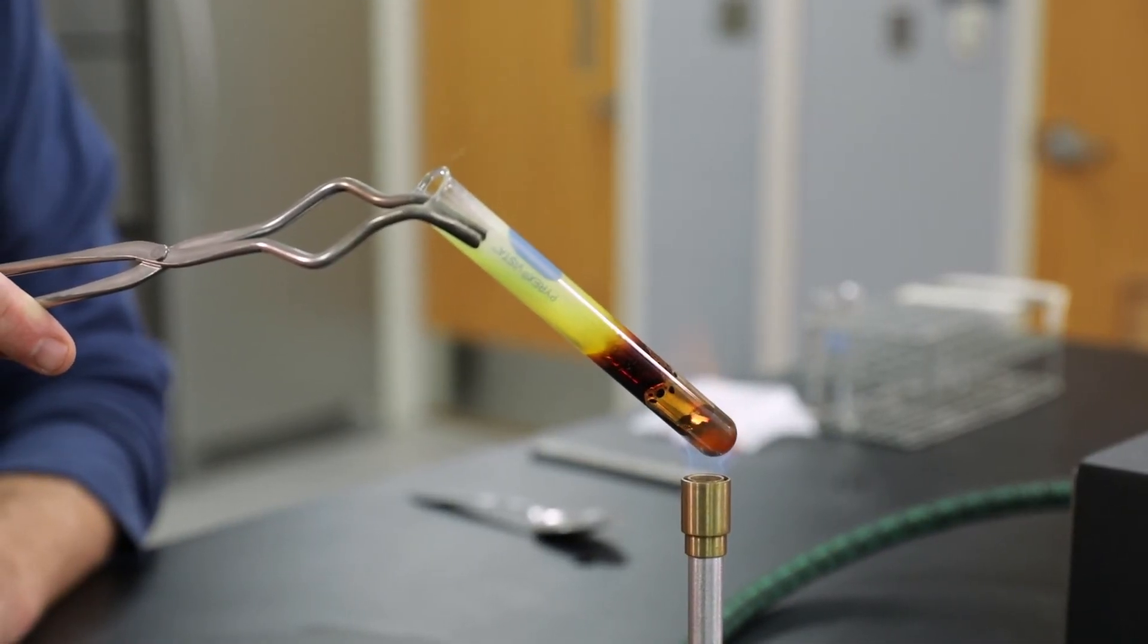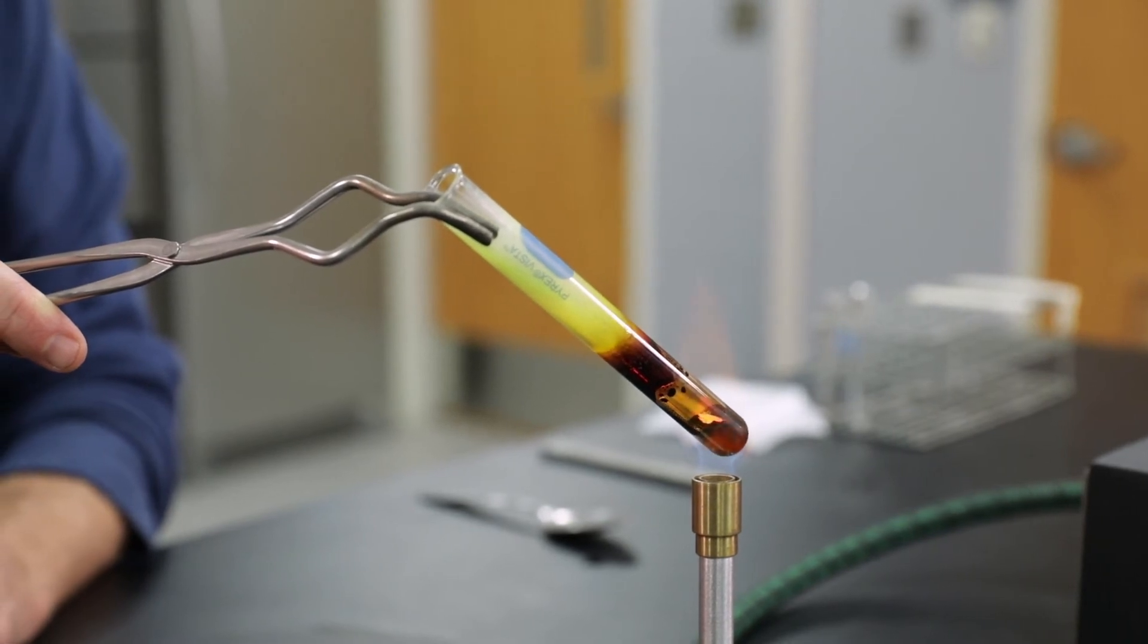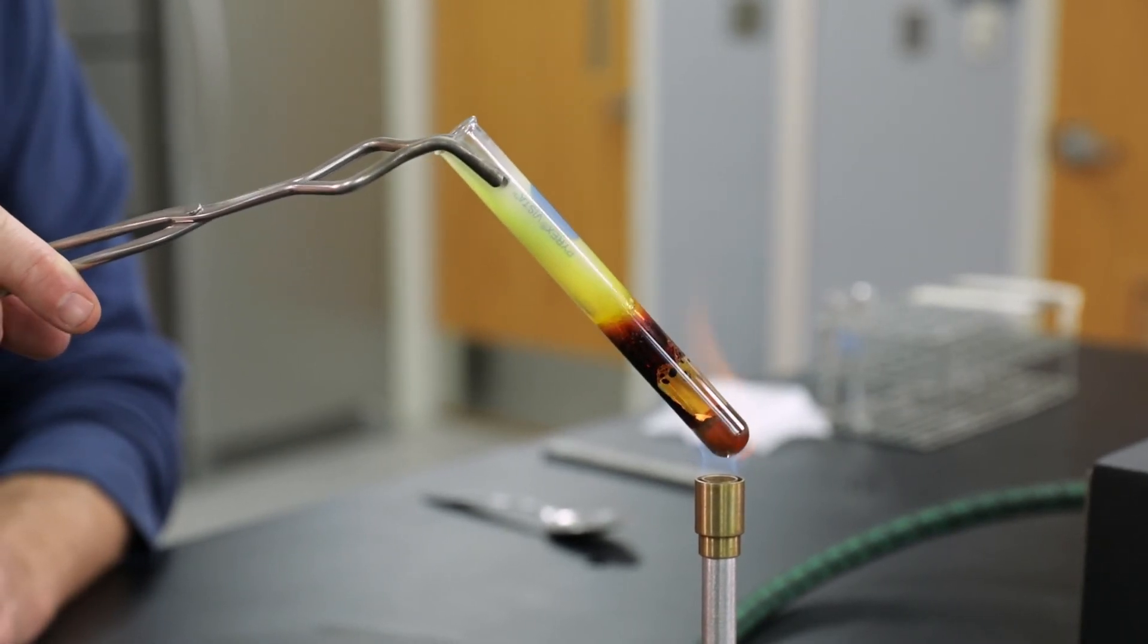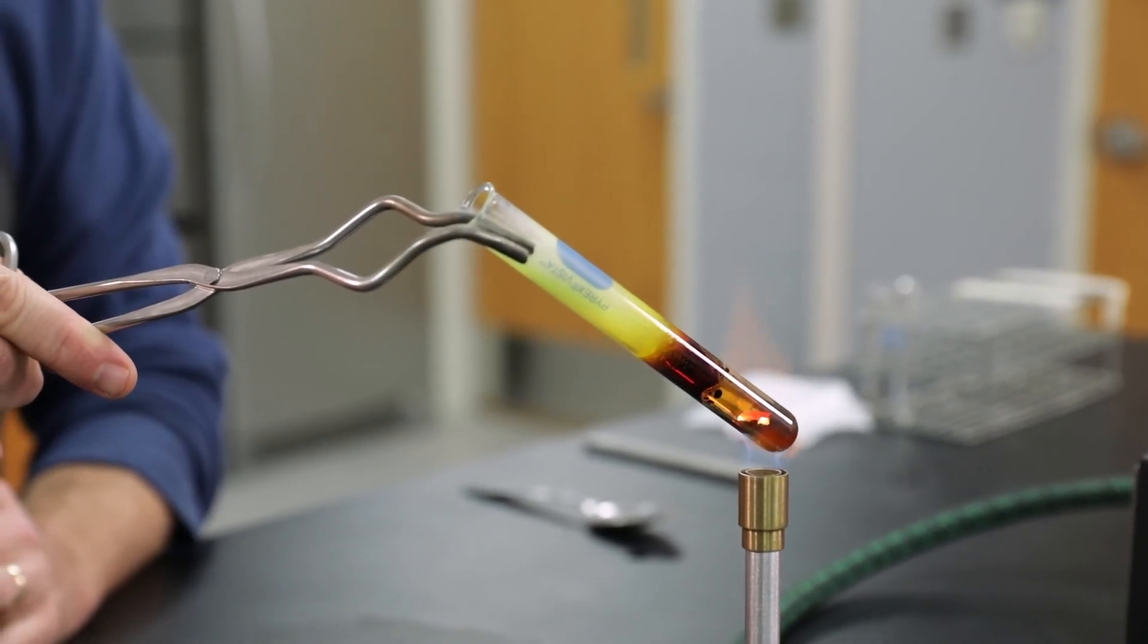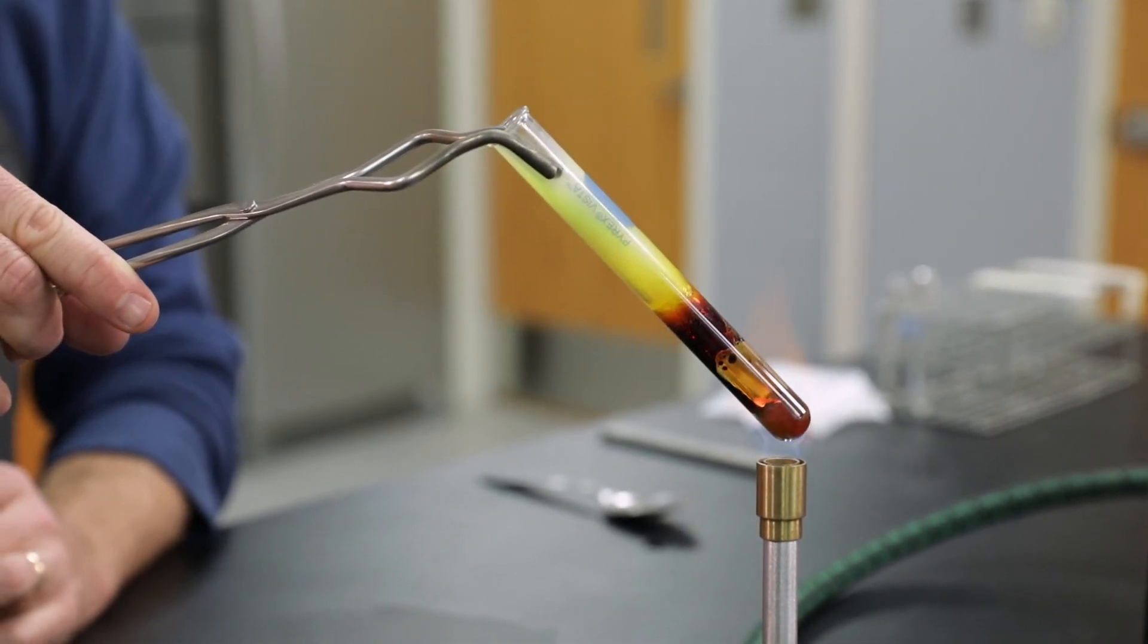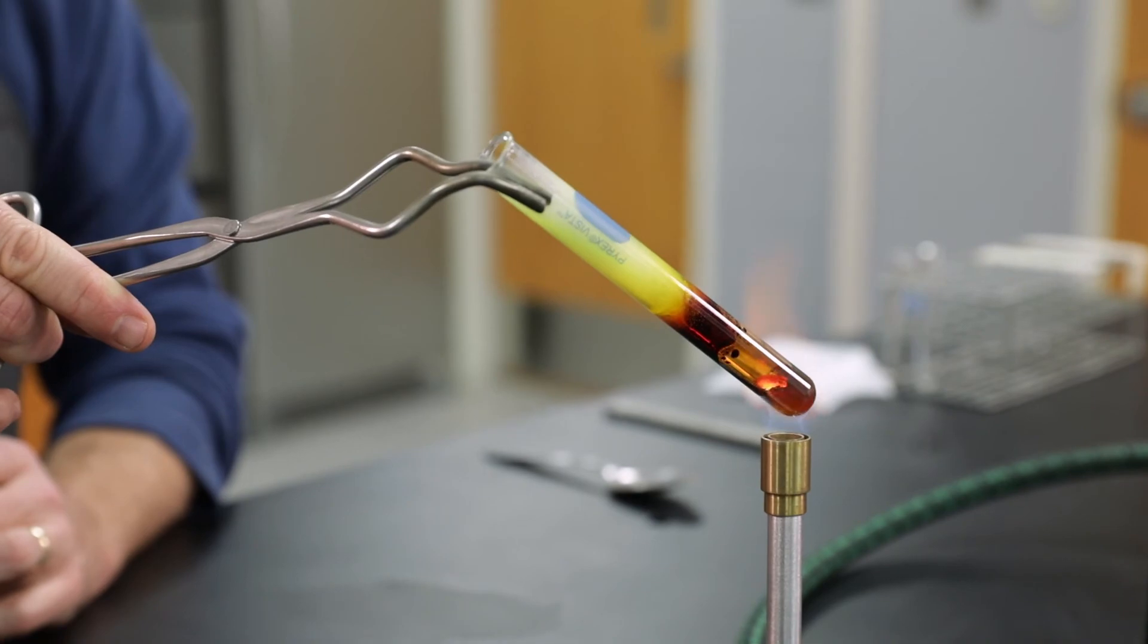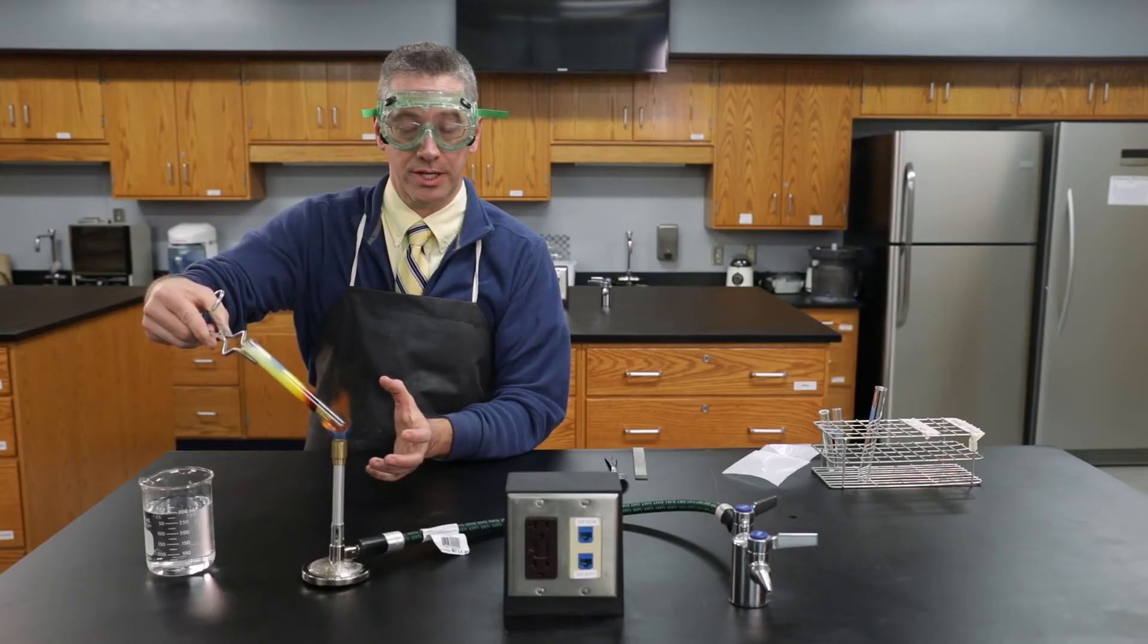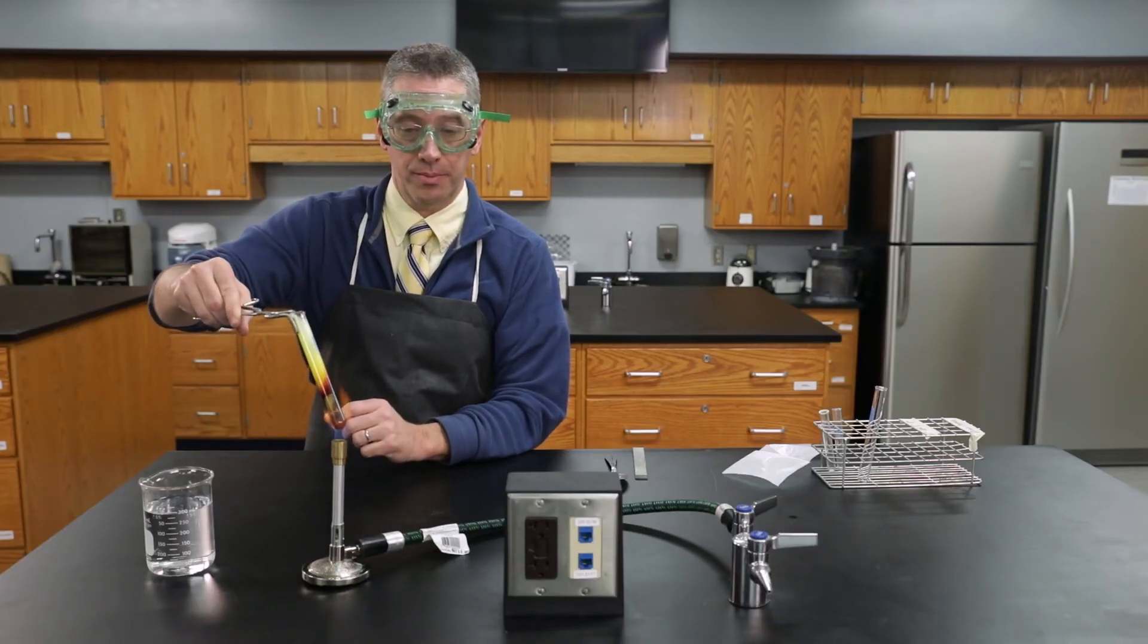Can you see the color change beginning? We're forming iron sulfide. We're going to keep heating for just a few more seconds to make sure we've got fully completed product.